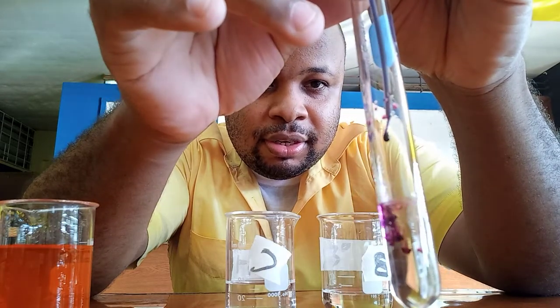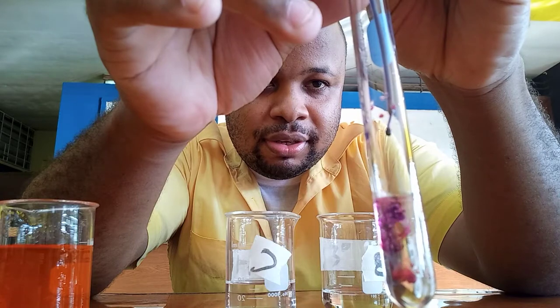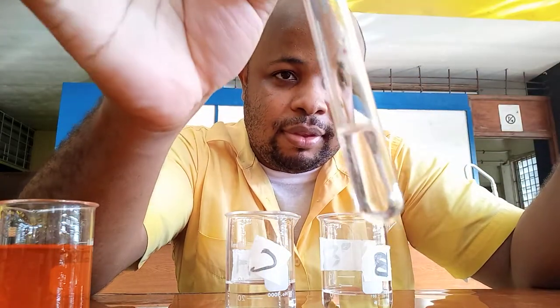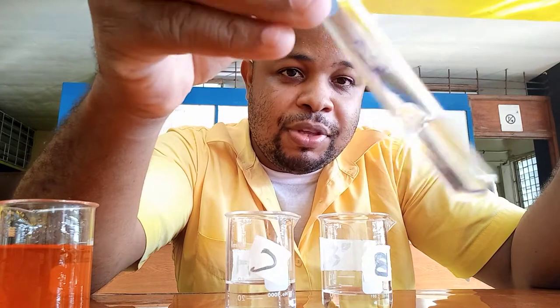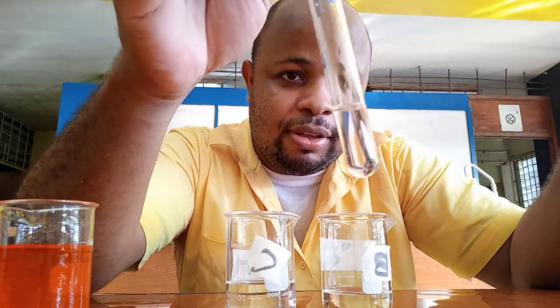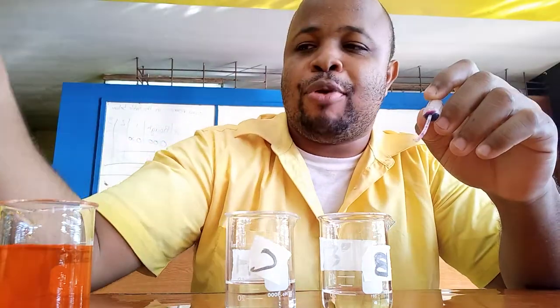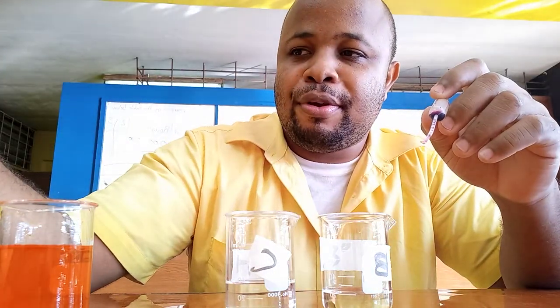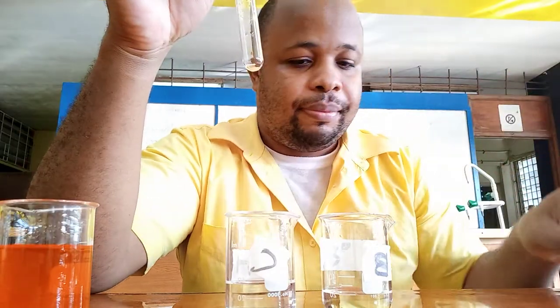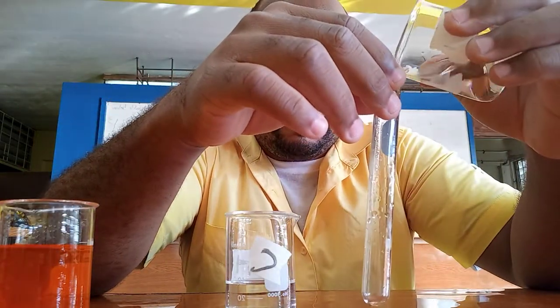The alcohol has just decolorized the potassium permanganate — it's gone colorless. This is either a primary or secondary alcohol, because both of them will react with potassium permanganate.